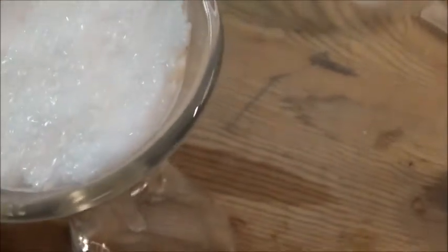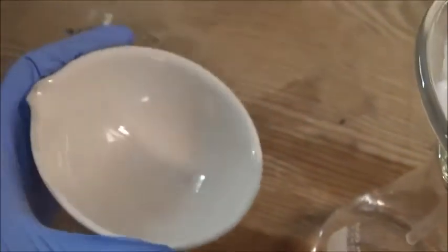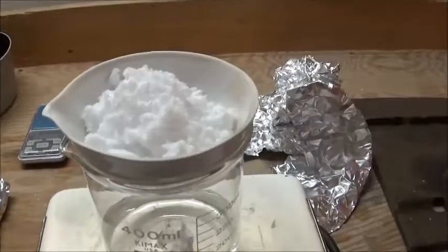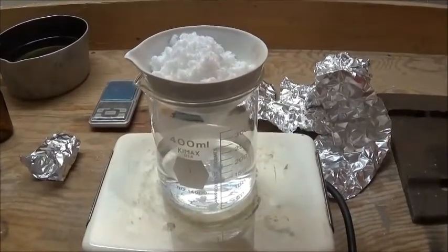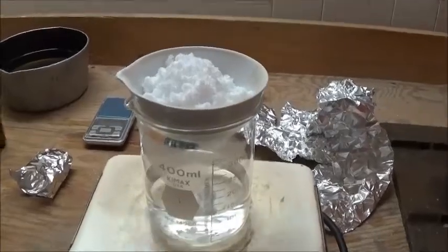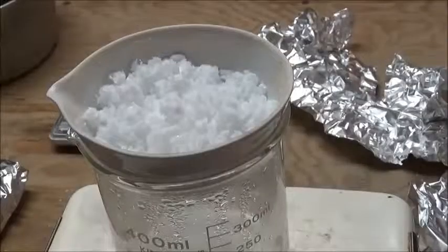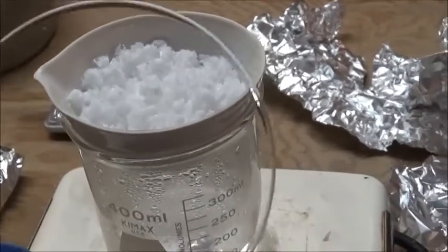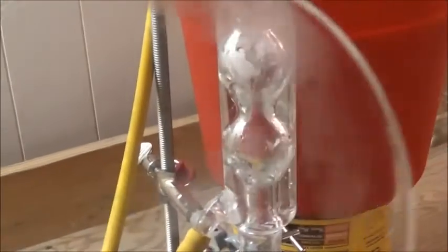These crystals only smell slightly of acetic acid, so I think I'll just wash them once more and let them dry. I squished down the crystals using the back of a spoon to get the last of the water out of them. Now we will transfer them to this large evaporating dish for drying. Put the crystals over some water on the hot plate — just going to dry it in a steam bath. I'm heating on the steam bath and not directly on the hot plate because salicylic acid can decompose at elevated temperatures, and that's not ideal. If you're not sure whether something is dry yet, get something cold like a watch glass at room temperature and hold it over what you're trying to dry. You can see any water vapor coming off will condense on the watch glass, and you can check it periodically until nothing else comes off — then you'll know it's dry.